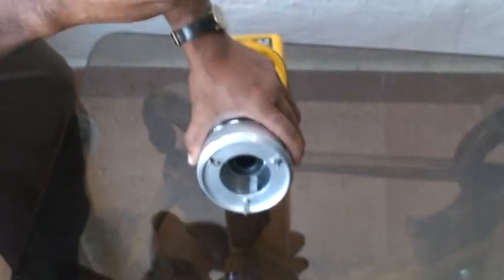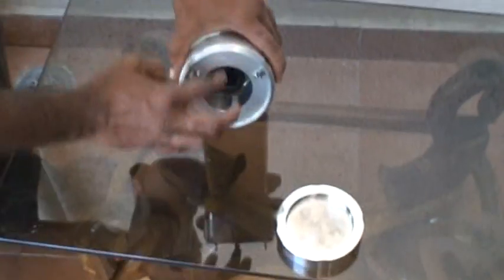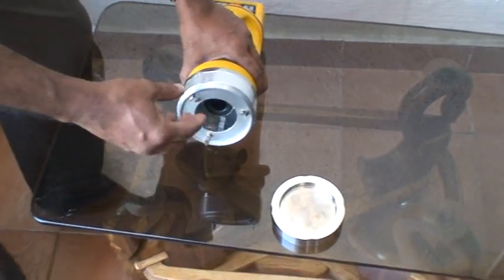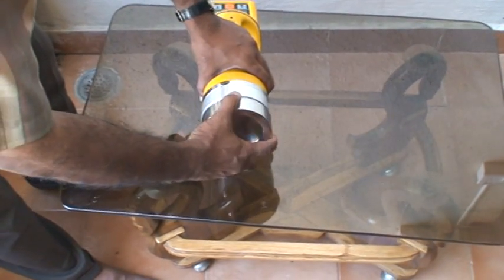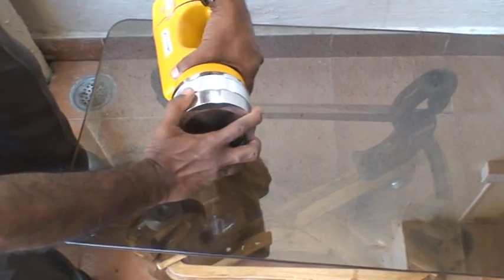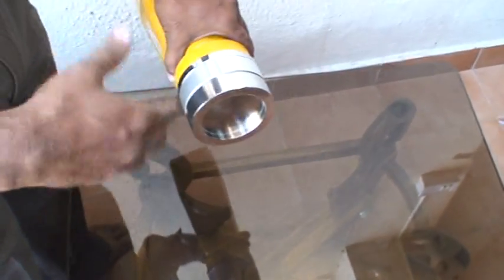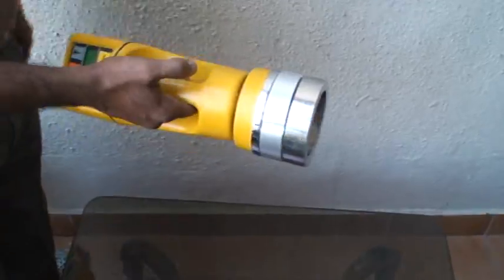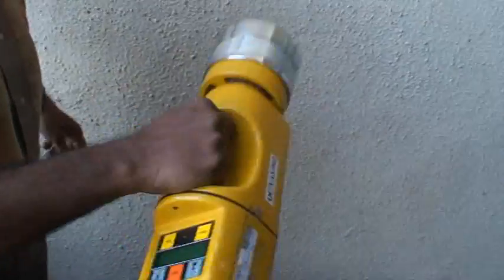It has holes in it. This is where you keep the petri dish with the agar plate and agar gel, and then you take the sample. After sampling is complete, you remove it and then do the incubation as usual. The advantage of this instrument is that it is very handy and portable.